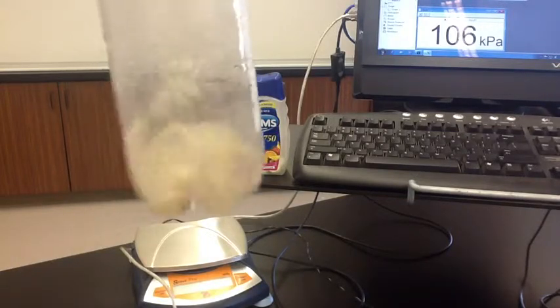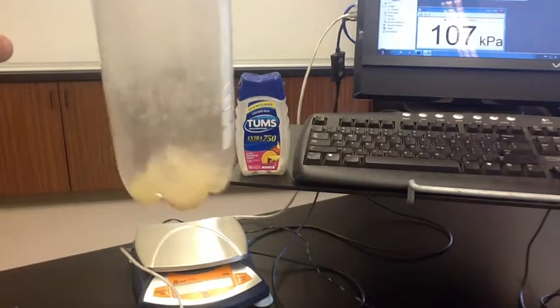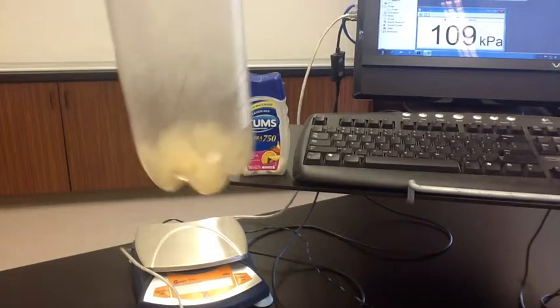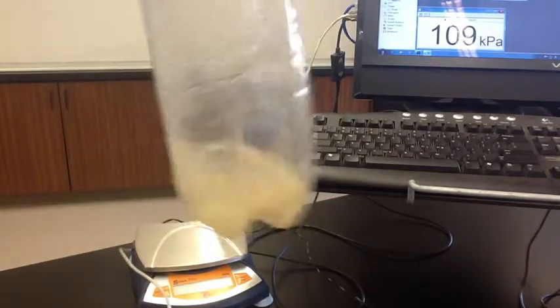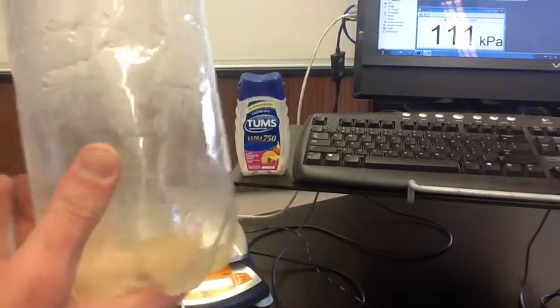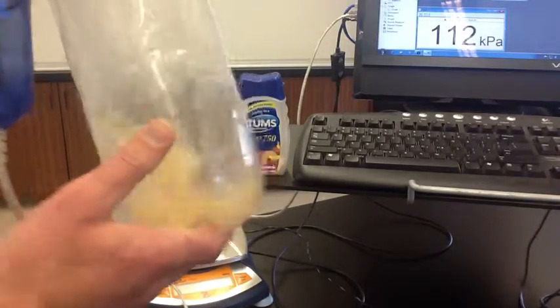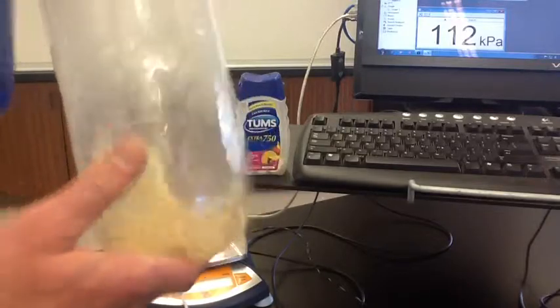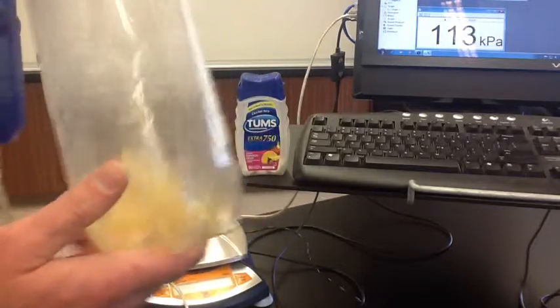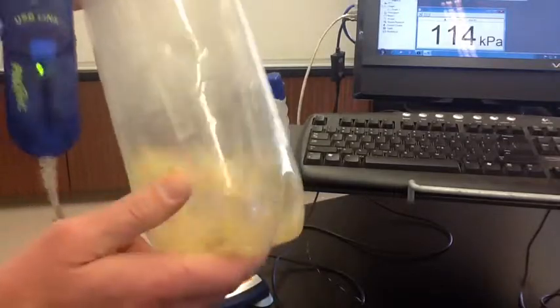We're going to shake it a little bit to help the reaction go faster. The pressure that we're concerned with is the change in pressure. We started with 101 kilopascals — the bottle had air in it, and that air was already creating pressure. So what we're concerned with is how much the pressure changes. The tablets are getting smaller and starting to dissolve, and you can see the pressure in the bottle is increasing — we're up to 114 kilopascals.